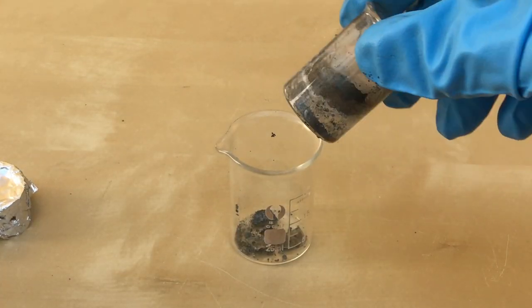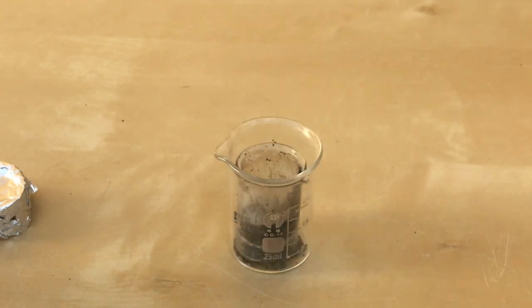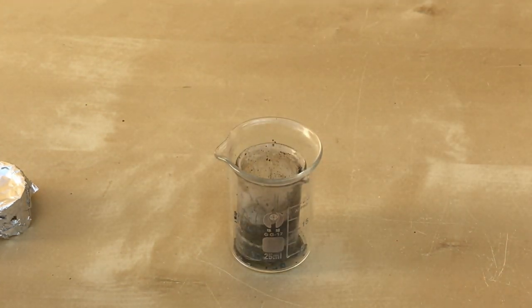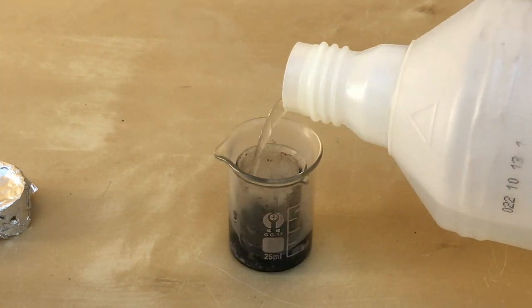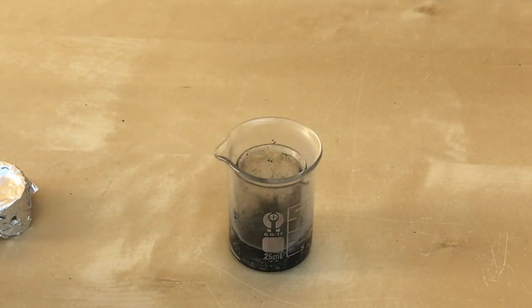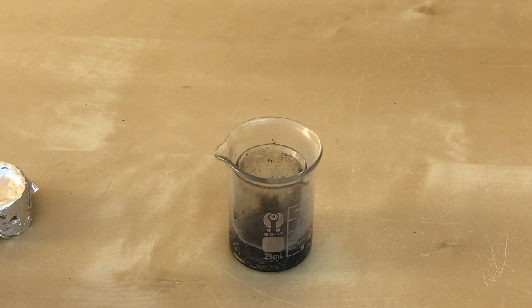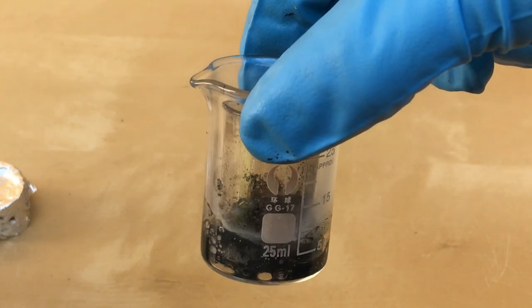Everything that remained in the beaker and the glass shards were put into a second beaker and we added some water to test the lead sodium alloy for its reactivity. Hydrogen was formed, but the reaction was not nearly as reactive as when dropping sodium in water.